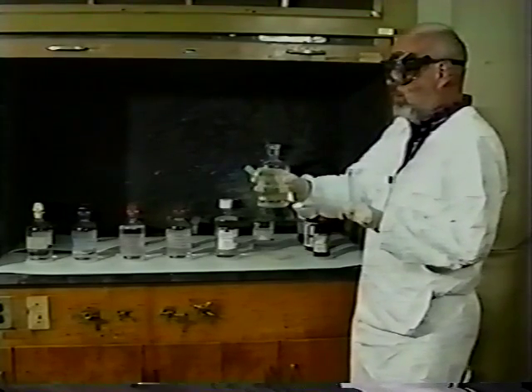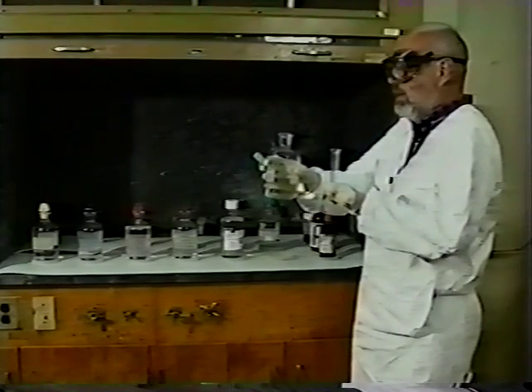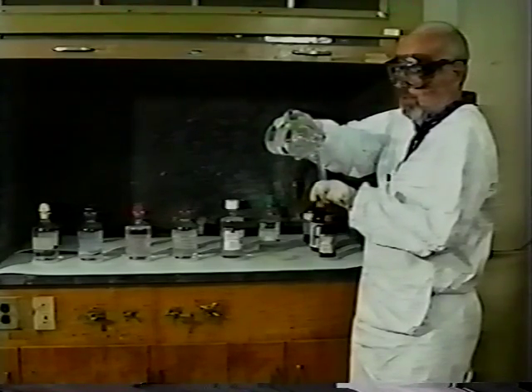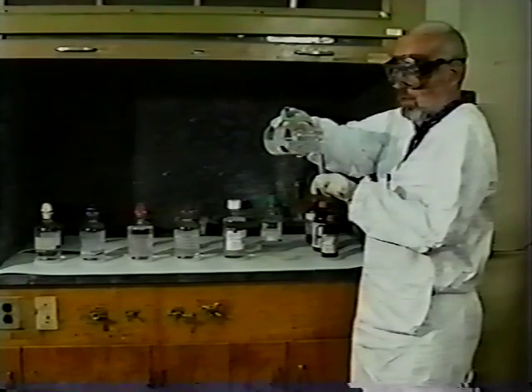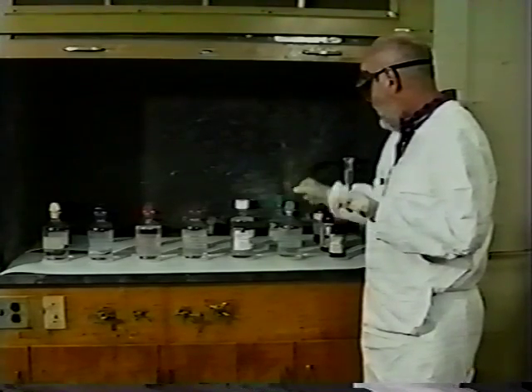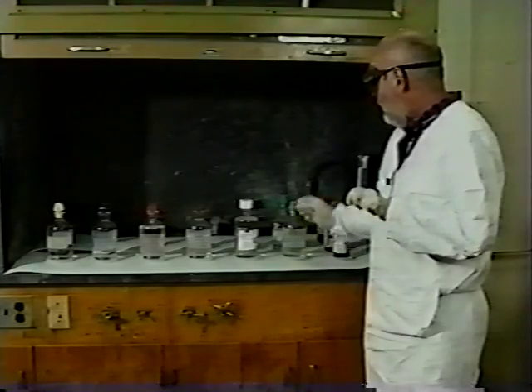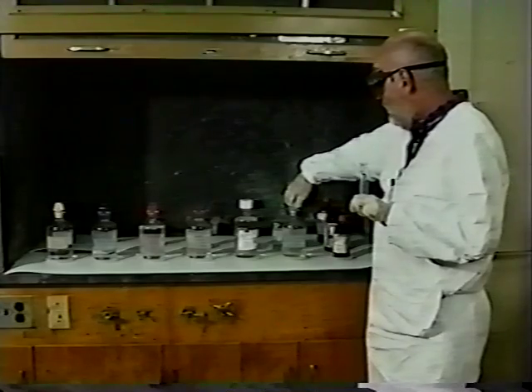The stopper is removed and the bottle is picked up with the same hand that grasps the stopper. The liquid is carefully poured to the desired volume in the graduated cylinder. Any drip is removed from the lip, and the bottle is set back into the saucer from which it was taken, so that in the event that there is any drip, it falls into the saucer, and the stopper is again replaced.